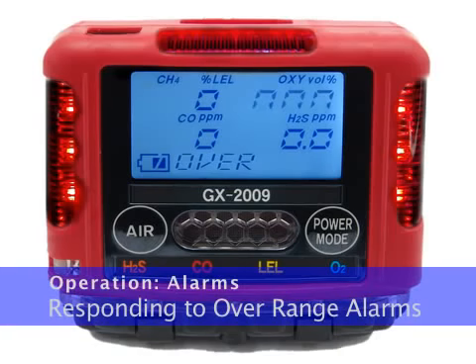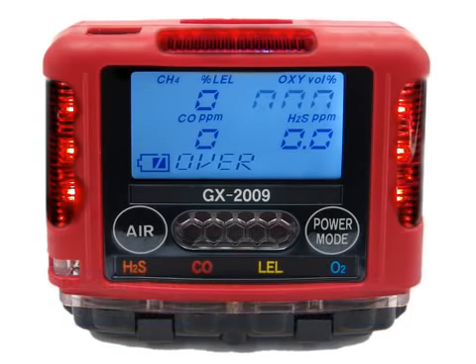An overrange condition may indicate an extreme combustible gas, toxic gas, or oxygen content condition. Take immediate action and confirm the gas levels in the area with a different GX2009 or with another gas detecting device. Reset the alarm using the power mode button once the alarm condition has been cleared.